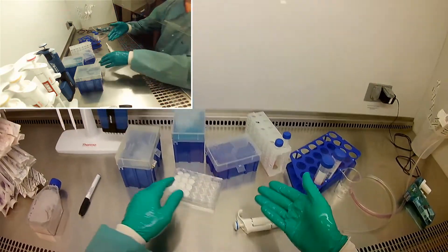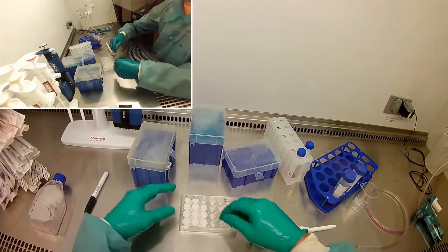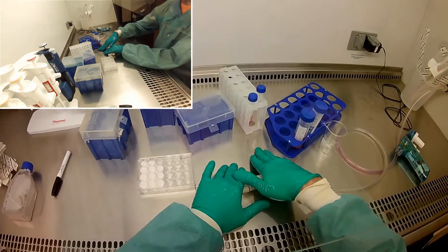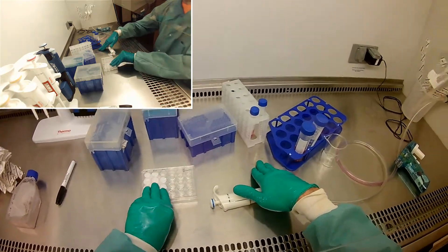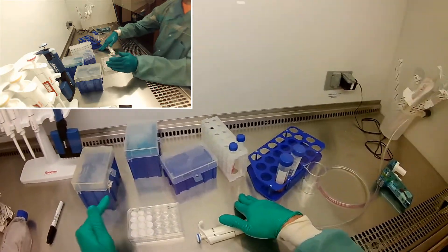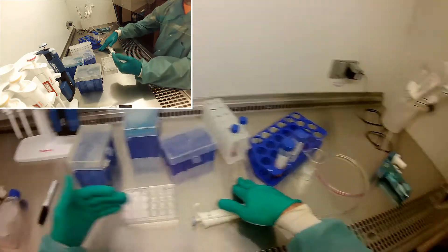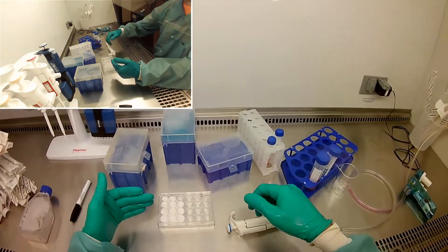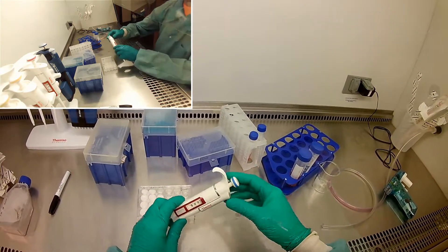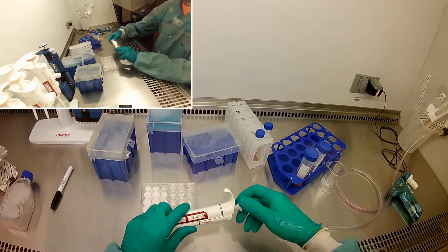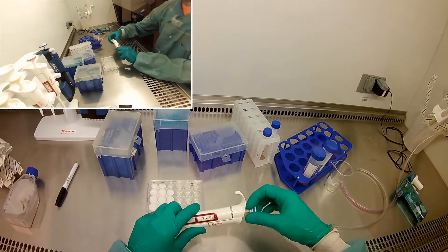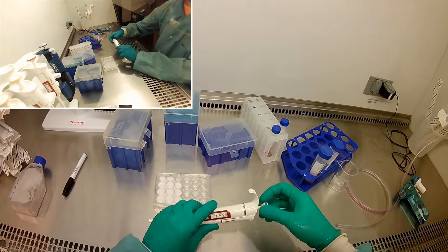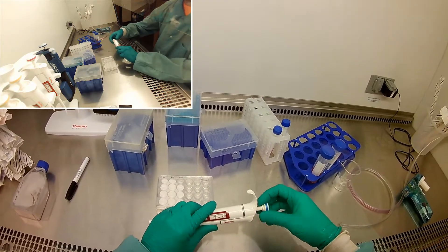Okay, so I've done all the math on what I want to do. So I have 12 wells in here. I'm going to make a solution of 12 mils so that it represents one mil per well. But I'm only going to put 800 microliters in each well because I don't want to run out. So I was able to figure out that if I do that, I need 150,000 total cells for my 12 wells.